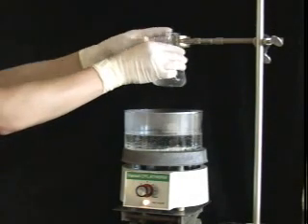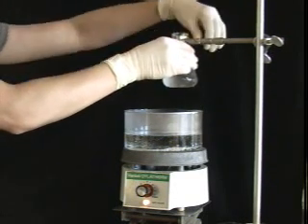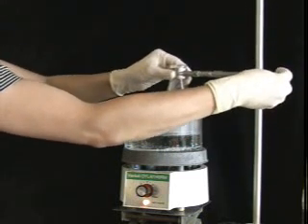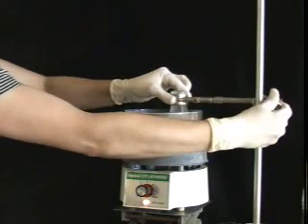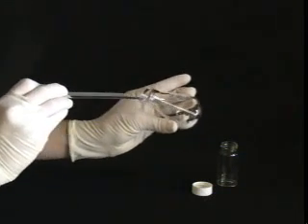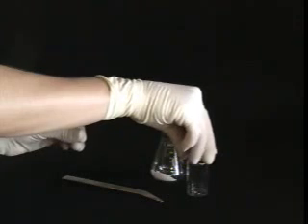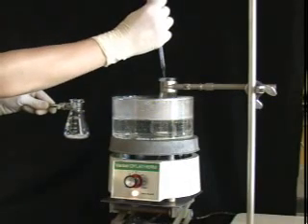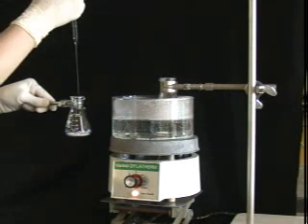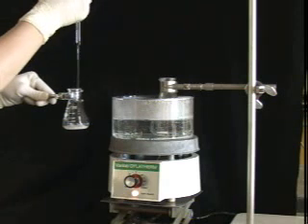Now that we have decided on a solvent, it is time to dissolve the sample in some hot ethanol. Get ready by heating some ethanol in the water bath. Remember to add some boiling stones and clamp the flask securely so that it doesn't tip over. Place the sample in an Erlenmeyer flask, but before adding solvent, it is a good idea to set aside a small crystal — it may come in handy later if you have trouble getting crystals to form. When dissolving your sample, use a minimal amount of hot solvent. This will ensure good recovery of crystals in the end. Add hot solvent in small amounts, swirling and heating in between each addition until the sample just dissolves.